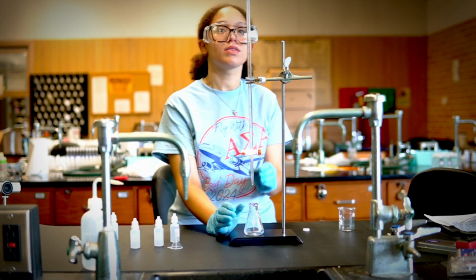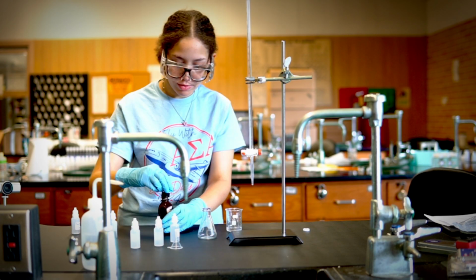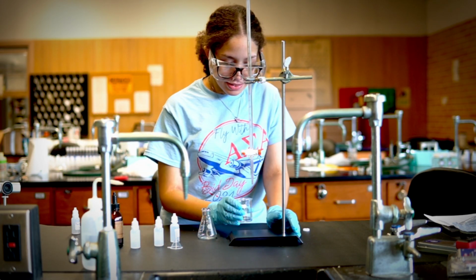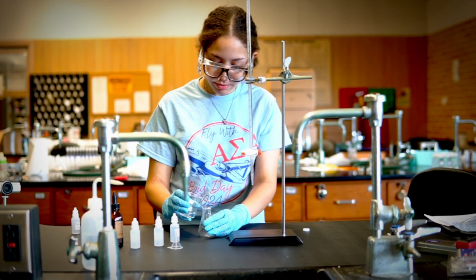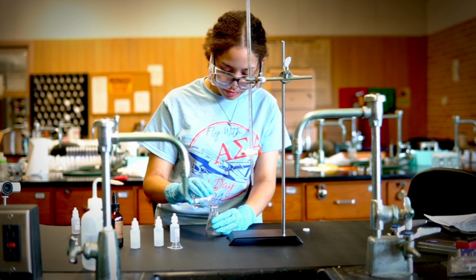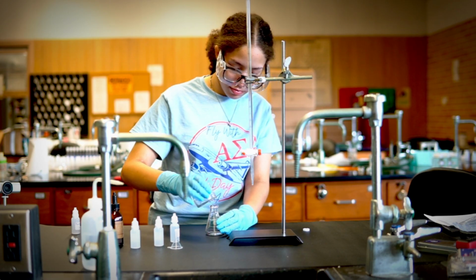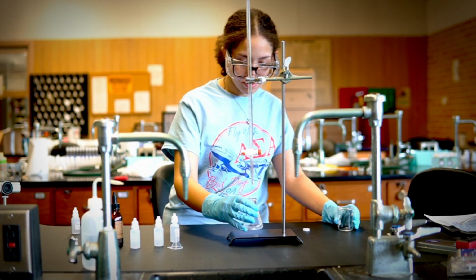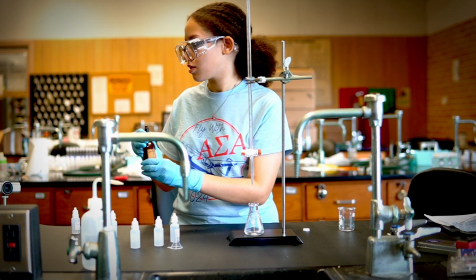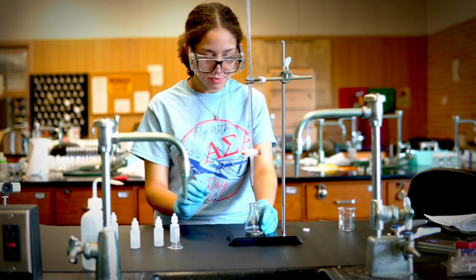And after you add your HCl, you are ready to add your NaOH. So go ahead and add your NaOH, right? After adding the indicator, add your NaOH on top. I think the procedure calls for about 10 milliliters. So make sure that you add your 10 milliliters into the Erlenmeyer flask along with your one drop of indicator. Put it right under your burette. You are then going to pour your NaOH into the burette, right?